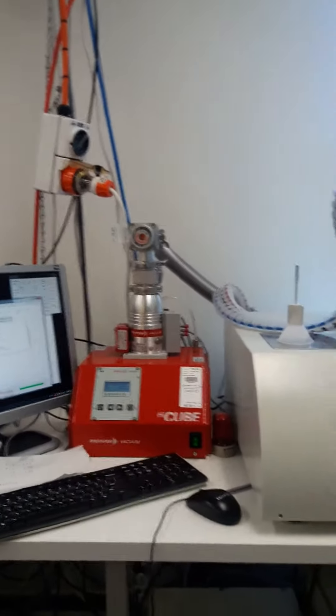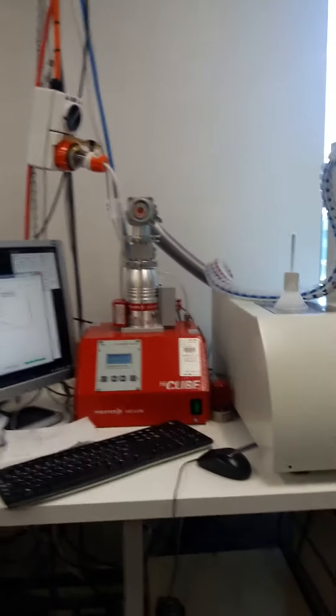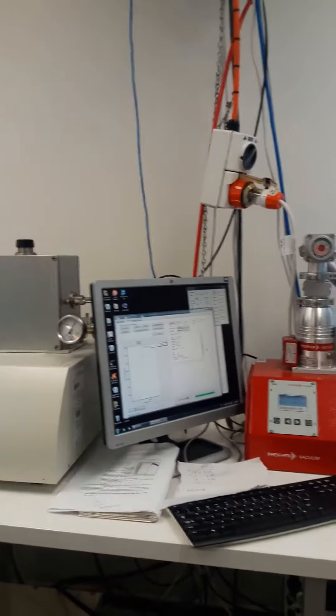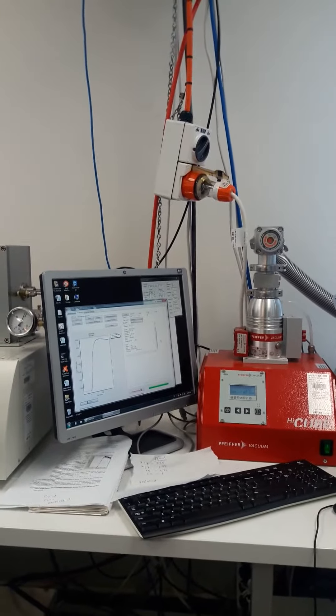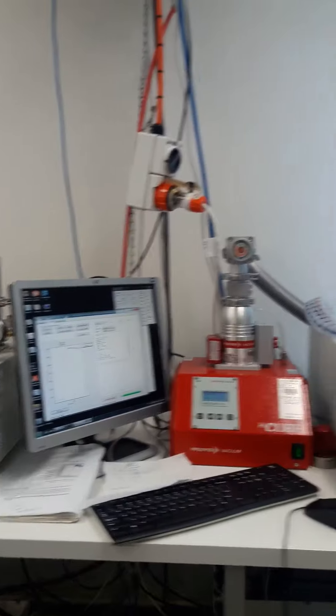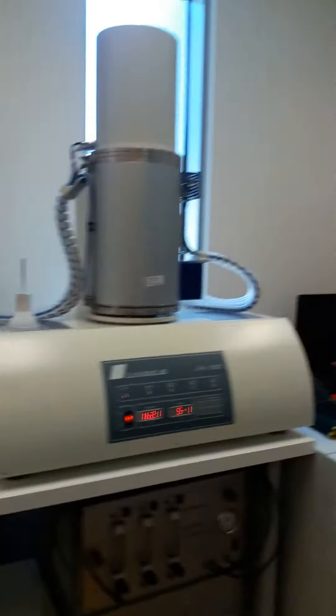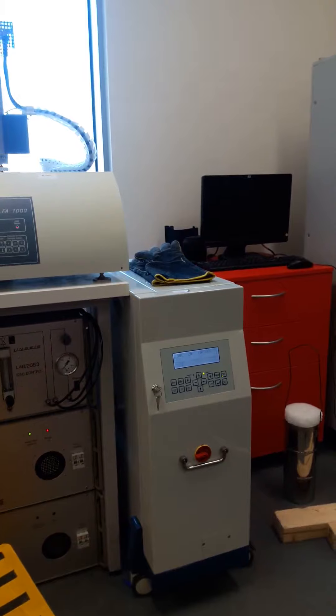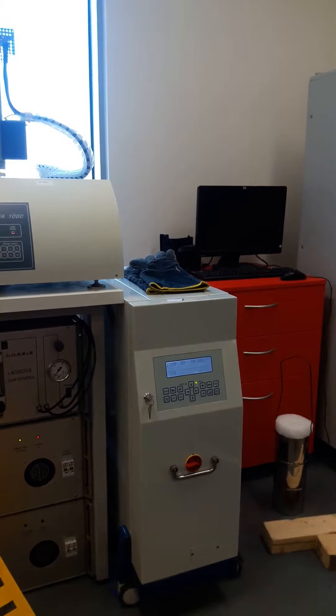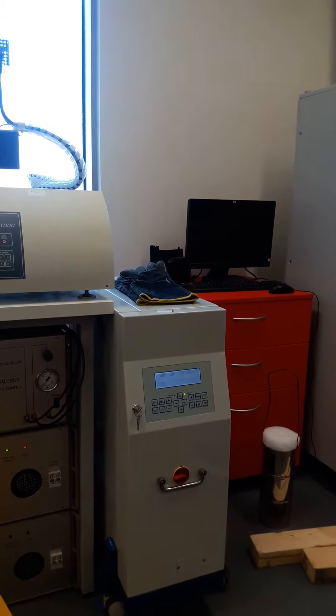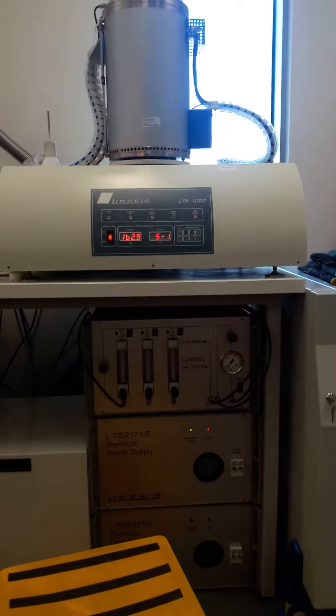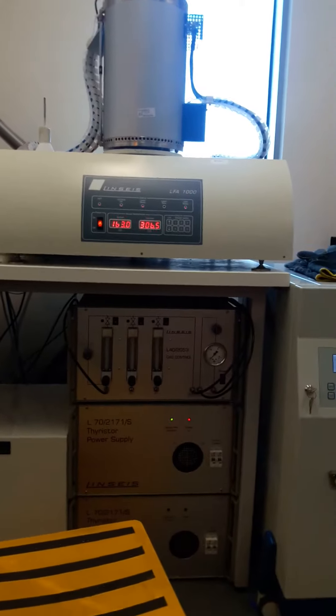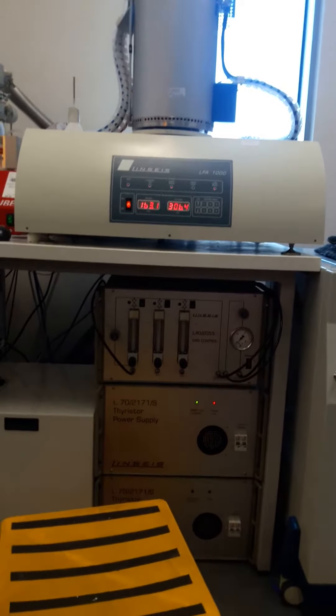This is to monitor your measurement. And this one is for laser control, this is the laser control unit.